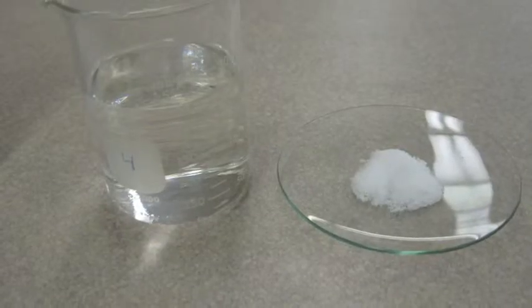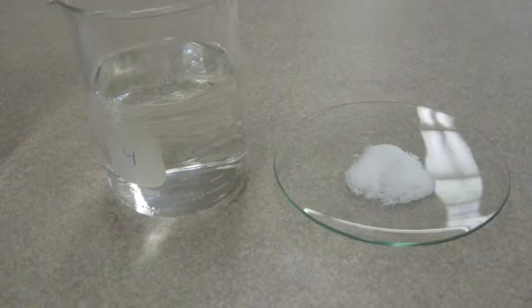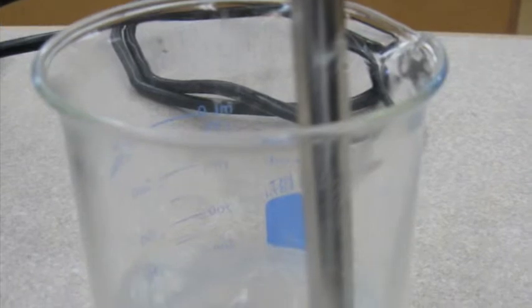This is what you need to do. Step 1: One person should weigh out 4 grams of sodium hydroxide on the watch glass and dissolve it in 250 milliliters of methanol in the 250 milliliter beaker. Using the glass stir stick, stir for about 10 to 15 minutes or until all of the solute is dissolved. This creates a methoxide solution.